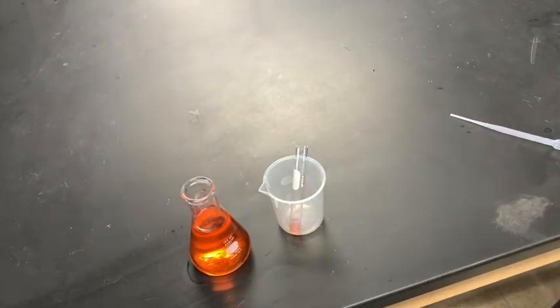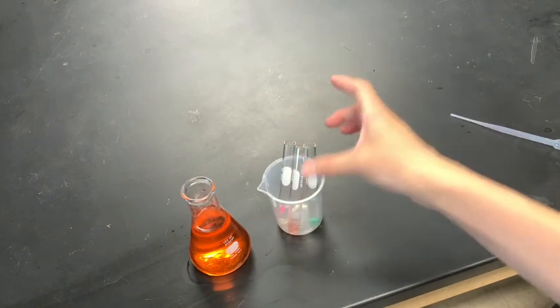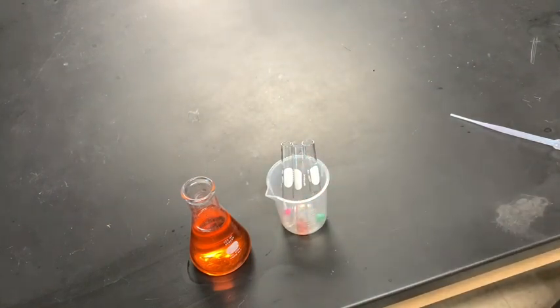This is especially useful if you have multiple test tubes and if you have to store them safely while you're making observations or writing stuff down.